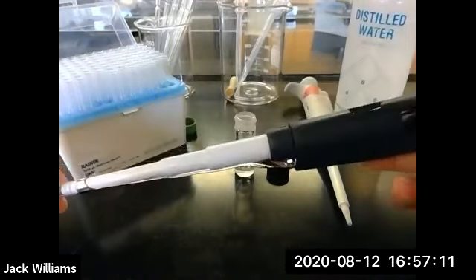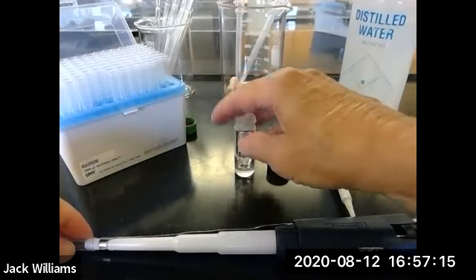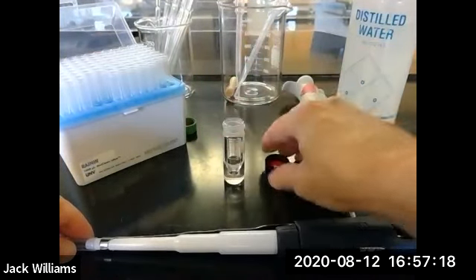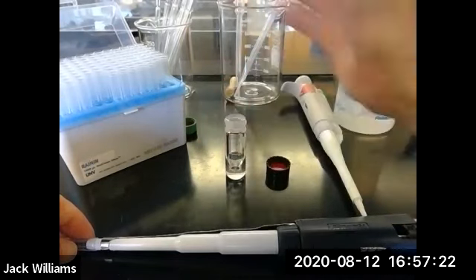Everything's ready to dispense 600 microliters of methylene dichloride into your conical vial. And then, of course, as soon as you dispense it, you're going to cap it because it is very volatile. If you leave it sit there for 5 minutes, it'll be gone.